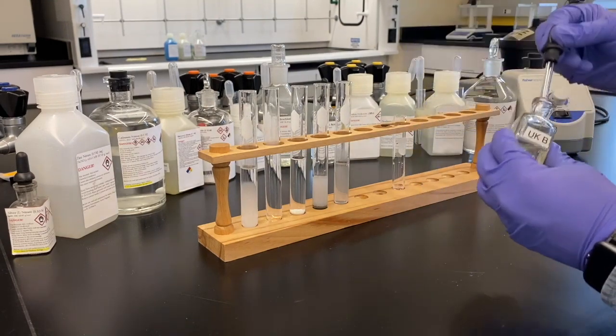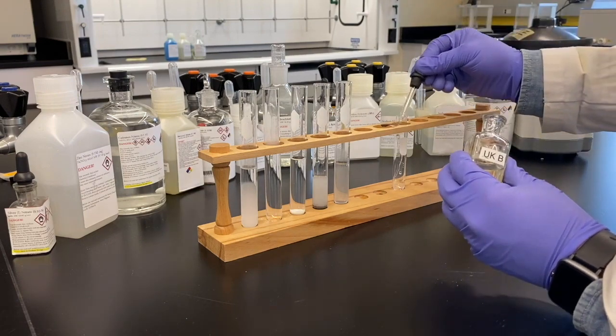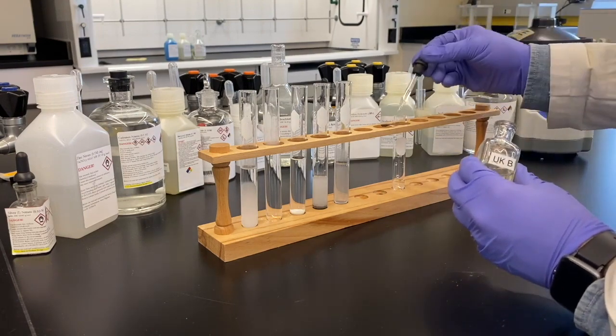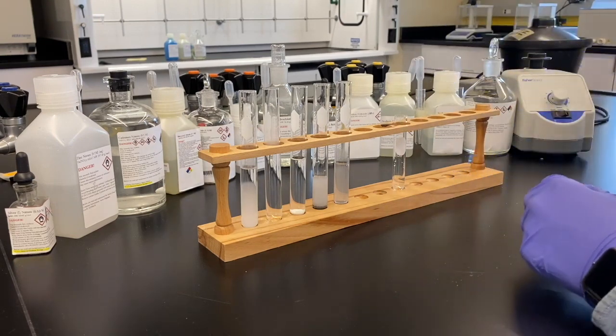All right, now we're moving on to the unknown section of the lab. Make sure in your lab notebook that you do write unknown B to get full points. Unless you don't want full points. Yeah, which, hey, maybe not everyone does. More power to you.